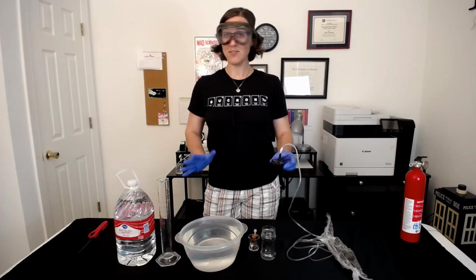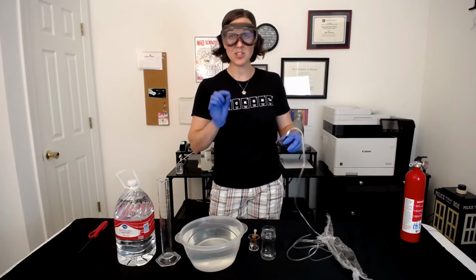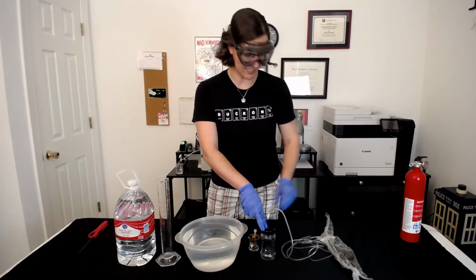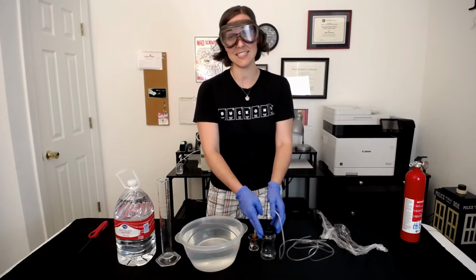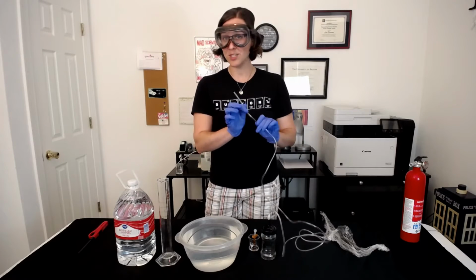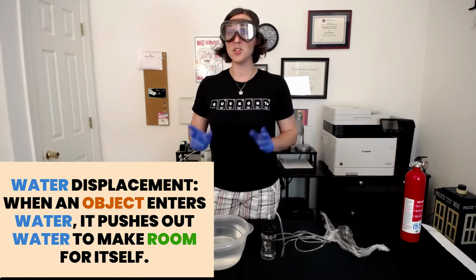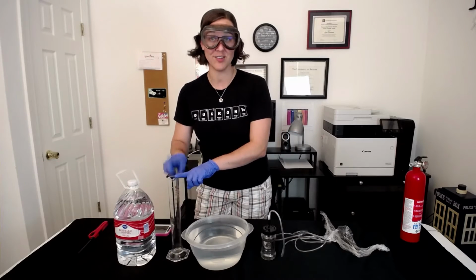The objective of this lab is to collect hydrogen gas, so we need a sealed system where we can choose where the hydrogen gas is going. That's where this little lid comes in handy. We're going to seal the reaction vessel and also put some plastic wrap around it quickly to hope that it doesn't escape from the sides, and then collect the hydrogen gas through the tube into a graduated cylinder that's inverted into a water bath. We're going to use water displacement to our advantage in order to trap the hydrogen gas inside our inverted graduated cylinder.